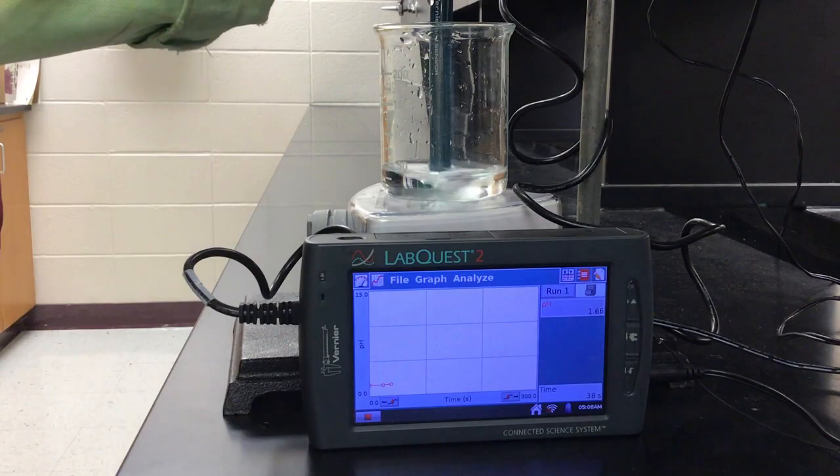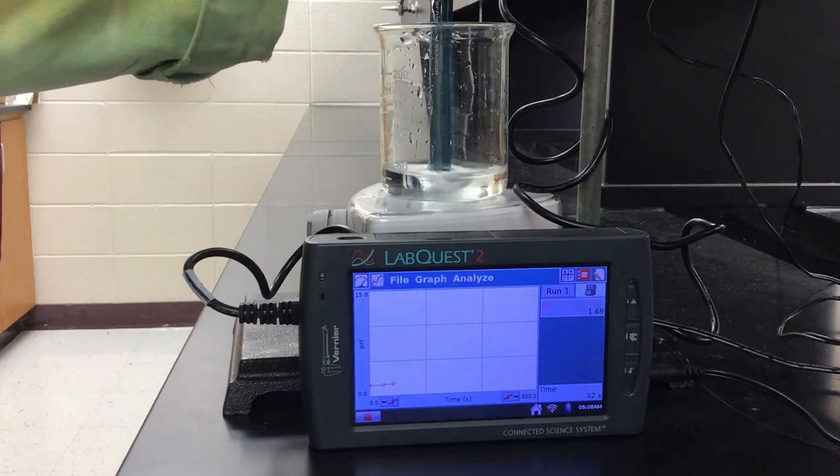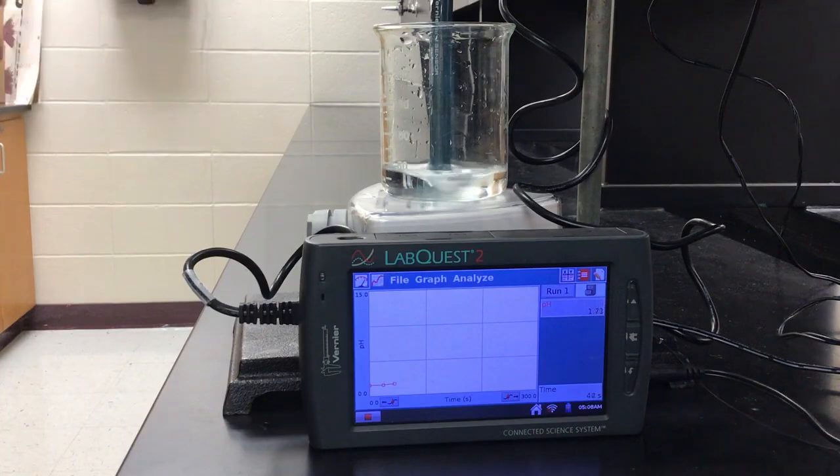Maybe turn it up just a hair. Just there, we go. That's pretty good. We'll let that go like that just for a minute.